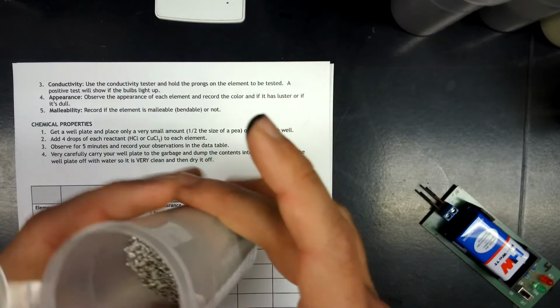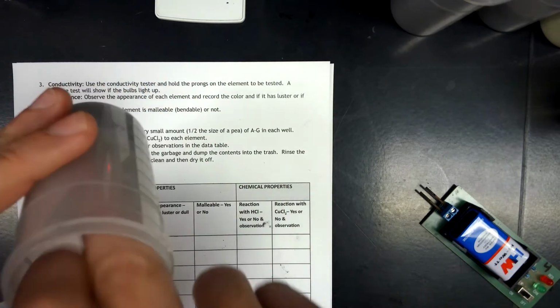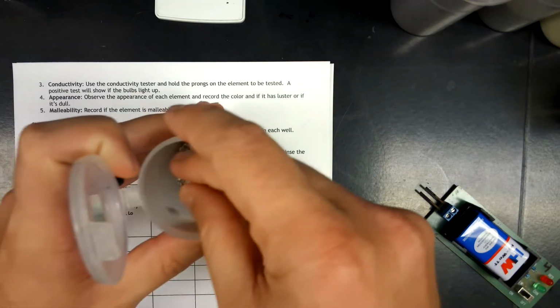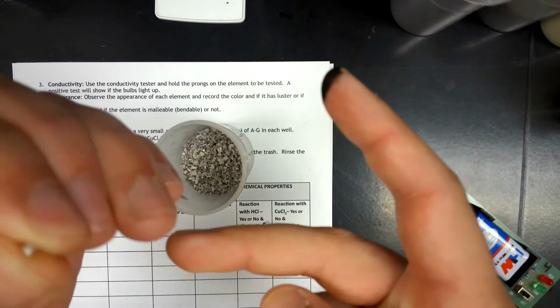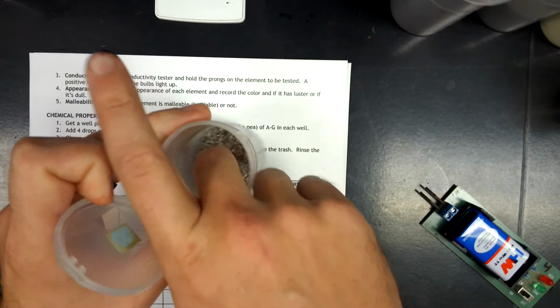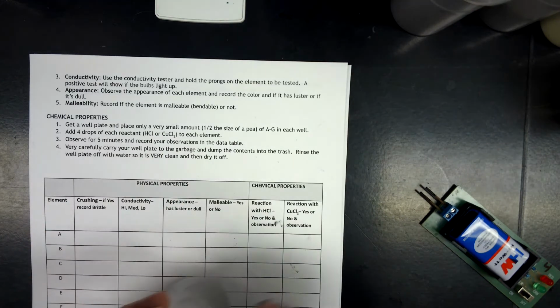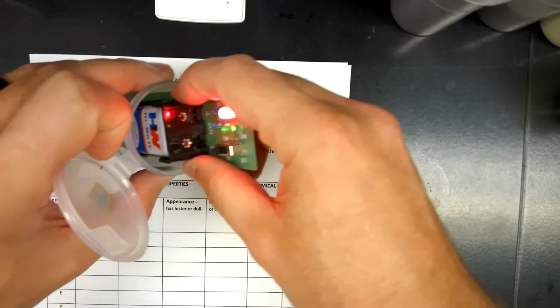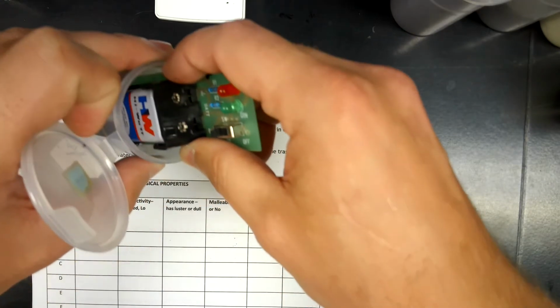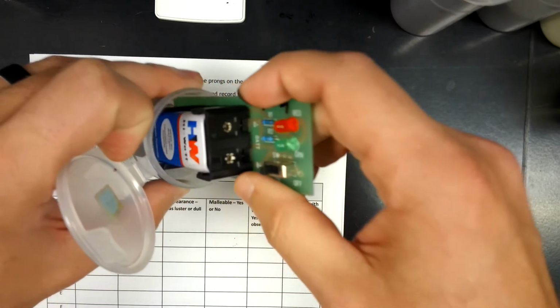Letter B, this one, silver in color. Let me see if I can get a piece out. Even with the small pieces here, I can actually bend these under my finger just a little bit. So that is malleable, which means that it's not crushable, which I can test with fingertip tests. You just get 1 or 2 pieces, not complete coverage. And lastly, conductivity. Once again, small pieces, hard to do, but I am getting that medium conductivity. I'm getting the green light to come on just a little bit at times.